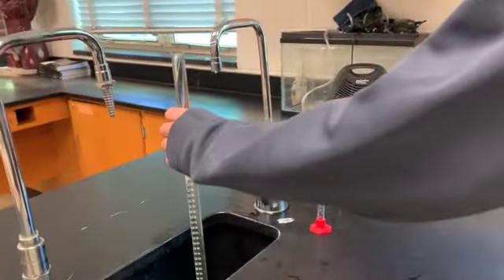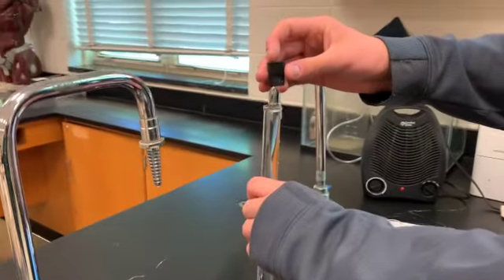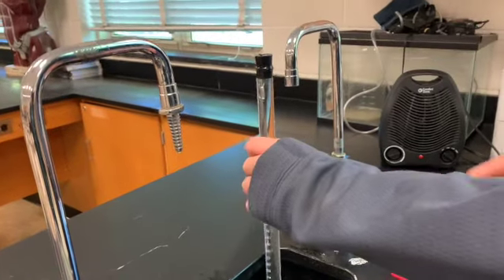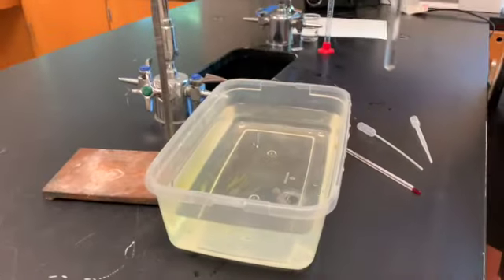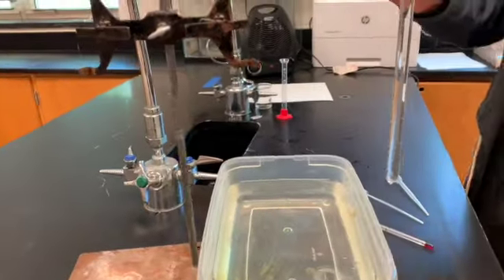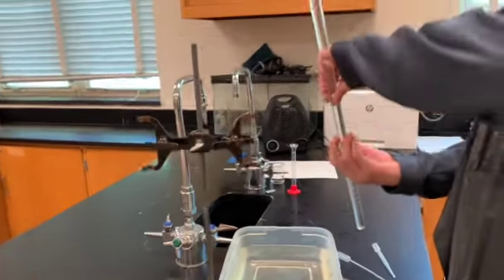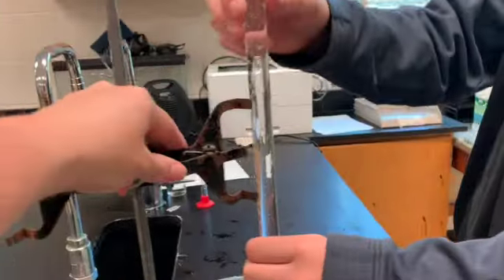All right, perfect. Now you're going to take the cork with the magnesium on the end, and we are going to just stick it in there. It's going to spill out, that's fine. Gently, gently, it's glass, okay. All right, so now we have a trough here filled just with water. He is going to take the gas collecting tube and invert it, so all the way upside down. Great, and we're now just going to clamp it here.